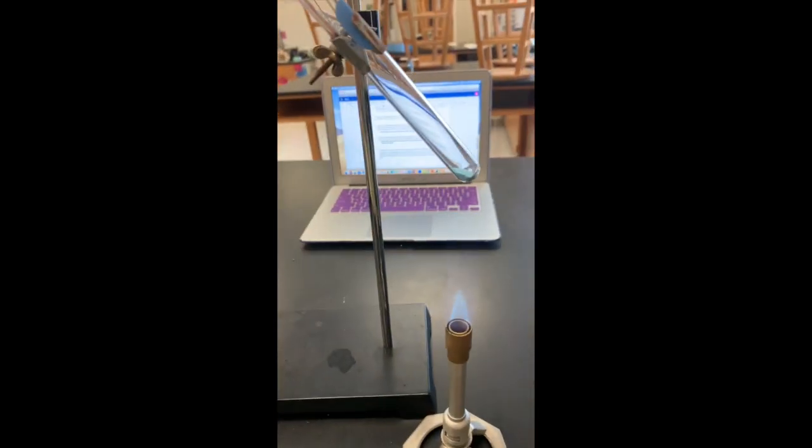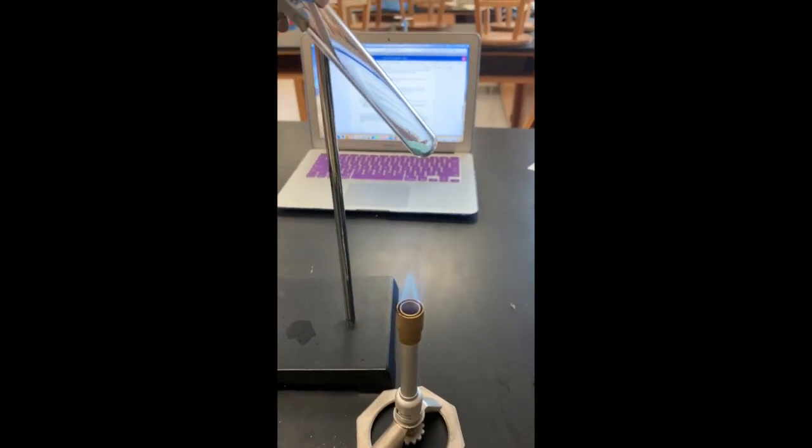We are going to let this sample heat for five minutes.